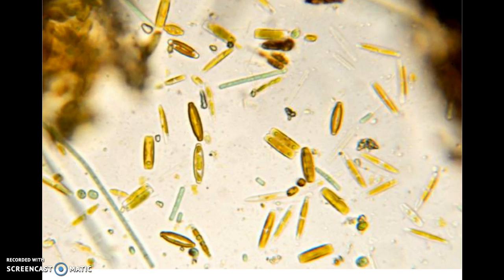And I'm sitting in the classroom right now, and I'm looking at the microscopes that are out from the last time we used them. And one of the things that I'd like to do is have smaller groups at the microscopes. There are plenty of microscopes. There shouldn't be more than three people at a microscope because this is something that you're really going to have to do at the end of the year as part of the state exam.